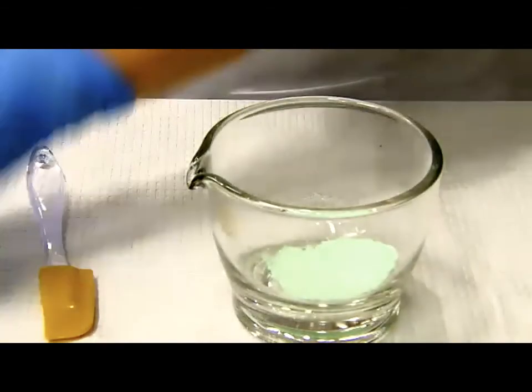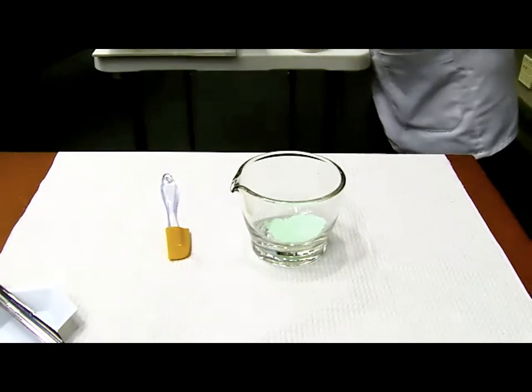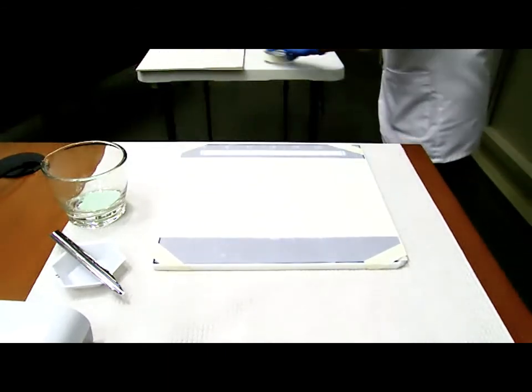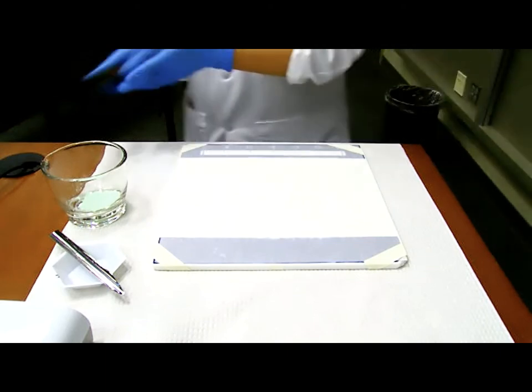Okay, so far all the procedures seem very familiar because this is the same as what you did for the powder. Now comes the new procedure, you probably haven't seen it. So let me read it just so you know where we are now. Judy's going to just do step 4 that says place the mixture onto a piece of ointment paper and block the mixture into a bed of powder using 2 large metal spatulas.